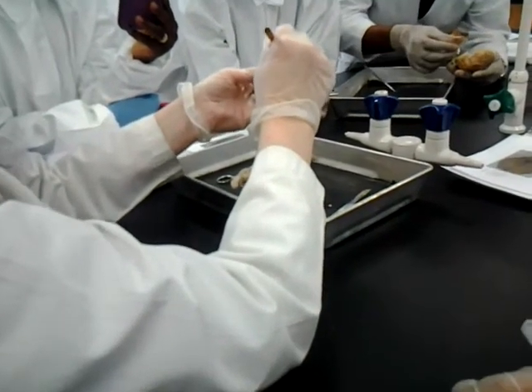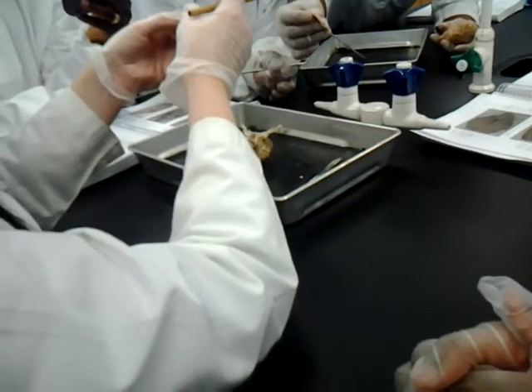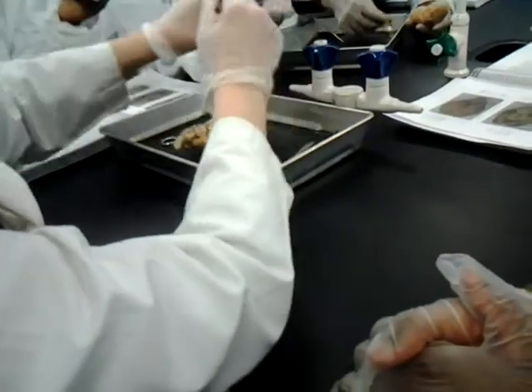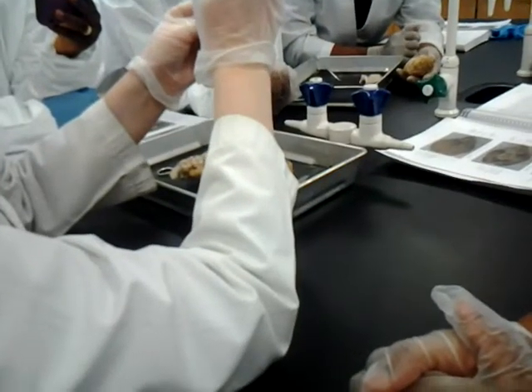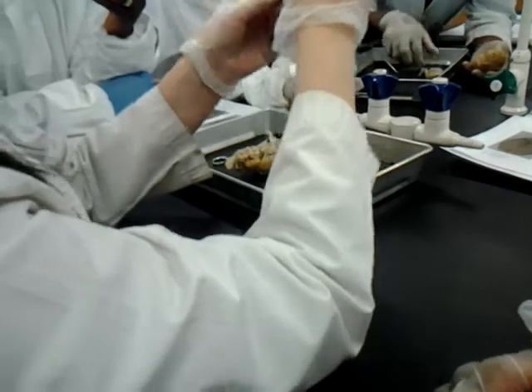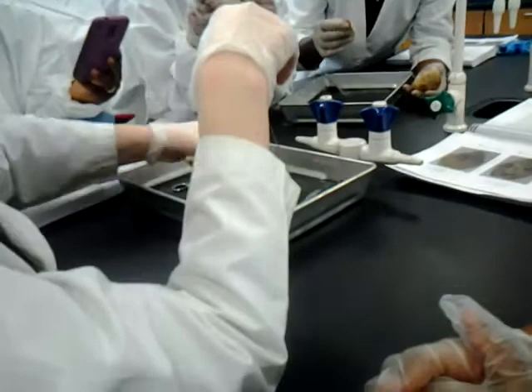It is like a bean shape, but remember, a lot of these get smushed, too. Is this it here at the tip of this? Exactly. Yep. So that's the infundibulum that connected to it, coming off here. This little brown tissue. That was the infundibulum that led into the pituitary. But you don't need to identify that because it comes off with our dura mater. Thank you. I'm going to hold on to yours for a moment.